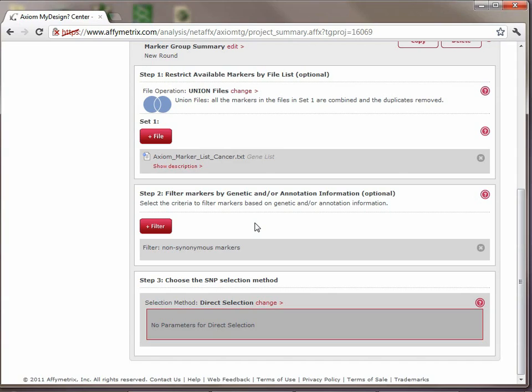But we'll finish creating the first one, and then I'll go through how to create the second marker group. So we've identified the genes that we're interested in. We're interested in a specific set of markers associated with them, the non-synonymous ones. And then we need to select the selection method for these. Because these are very important to us, these are the most important SNPs, and we want to get coverage of them all, we want to look at the selection method, and we have direct selection selected. That means that if it was found to be validated in the Axiom genomic, if it works with the Axiom assay, that it will go on the array. If it's not validated, it won't.